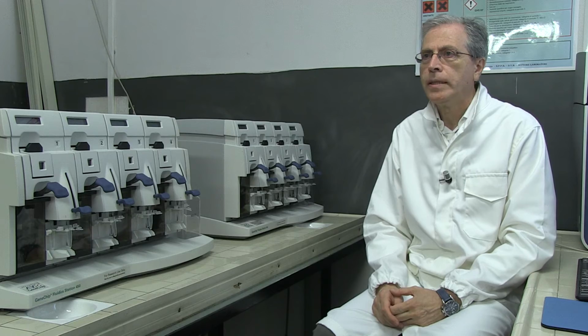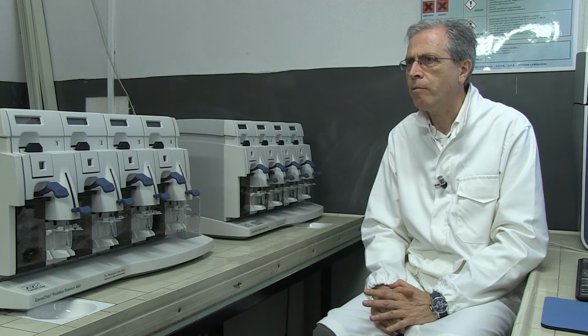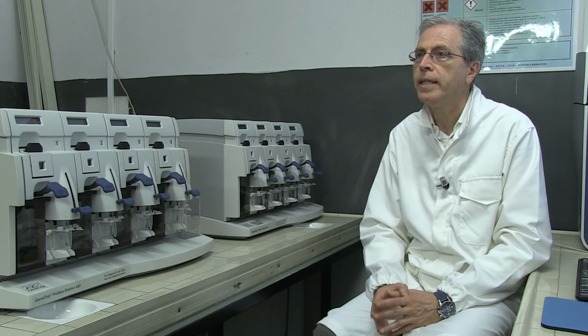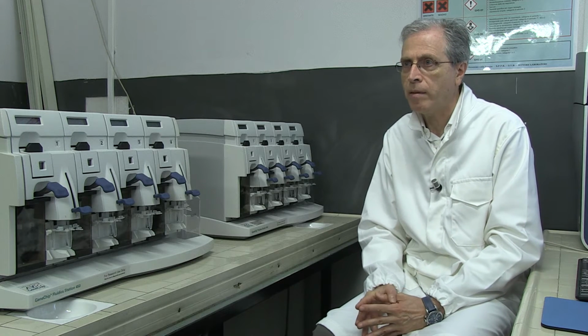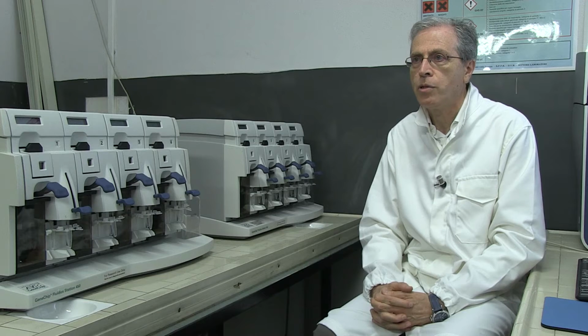Today, we will use an array produced by Affymetrix called Human Transcriptome Array 2. In this particular array, probes of 25 nucleotides are covalently fixed to the surface of the microarray. This high-resolution array contains 6 million different probes. 70% of these probes cover exons of coding transcripts, and the remaining 30% cover splice junctions or non-coding transcripts. On average, 100 probes per gene are used.